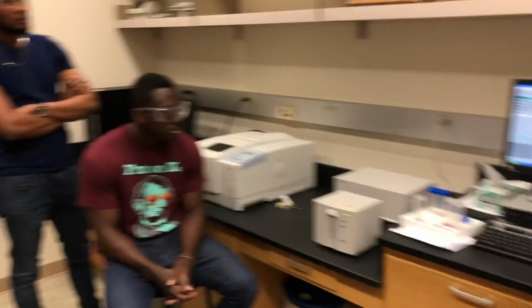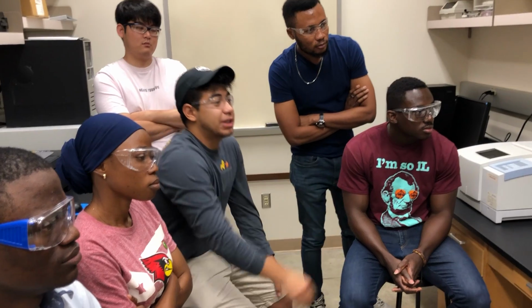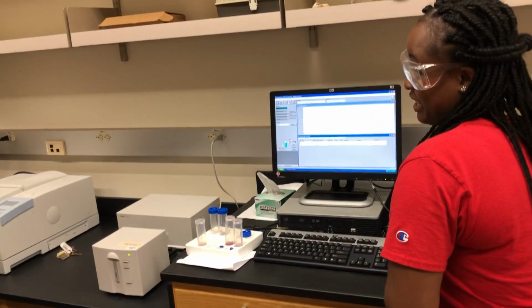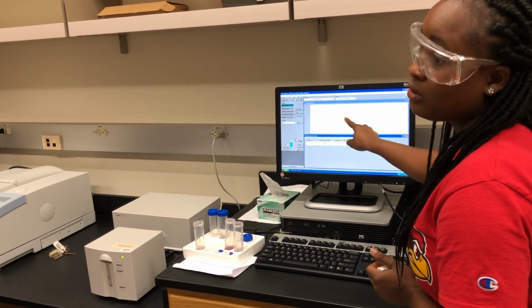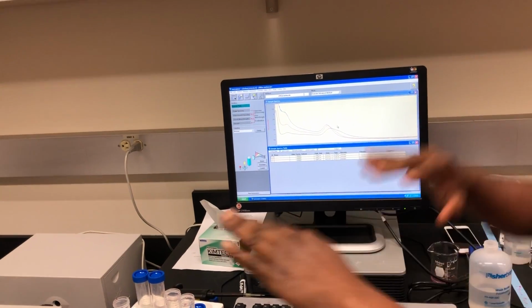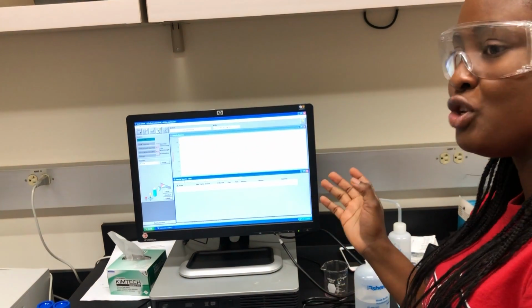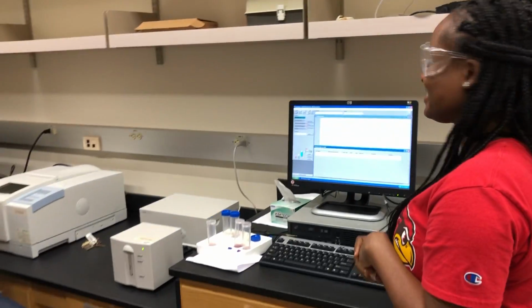I have one question. Okay. Are the other peaks in the beginning important, or is it just that little peak that's significant for us? This is the significant peak that we need, yeah. That's where the gold nanoparticles absorb. I see. It absorbs around 520 up to 600. It depends on the size of gold nanoparticles you have in your solution. Okay, that makes sense. Awesome.